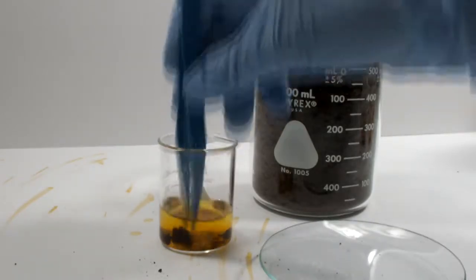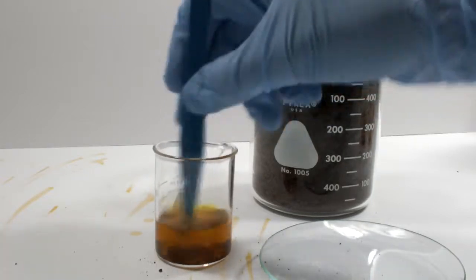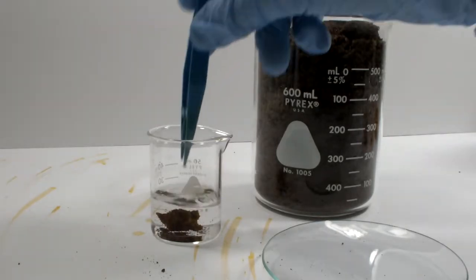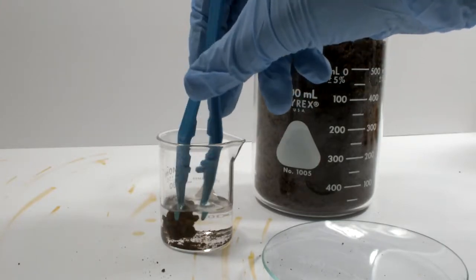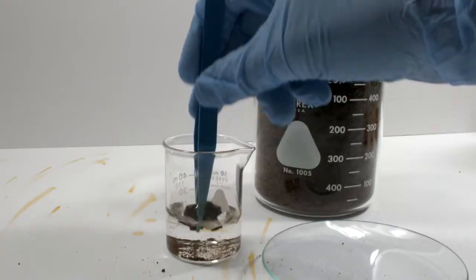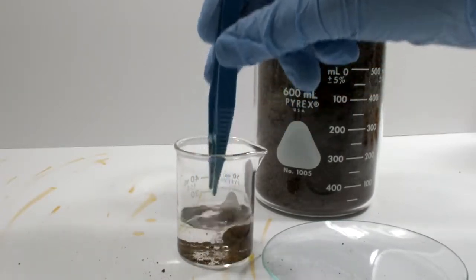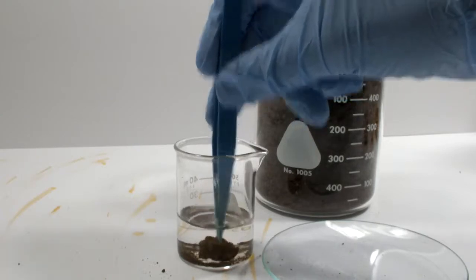Acetone is the last of the polar solvents I'm going to try. It does break apart the junk pretty effectively, but once again, I have a dud piece. When I initially set about trying to recover this stuff, I thought that using a nonpolar solvent would prevent the iron chloride from dissolving. I tried naphtha, which is a completely nonpolar mixture of aliphatic hydrocarbons. I'm recreating that experiment to show that, while it's true, iron chloride will not dissolve, it's completely ineffective at removing the oxidized coating too. Notice that the liquid isn't taking on an orange color like previous tests. That's going to be useful information in a little while.